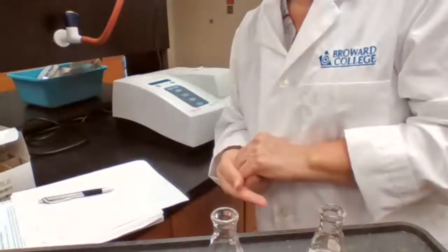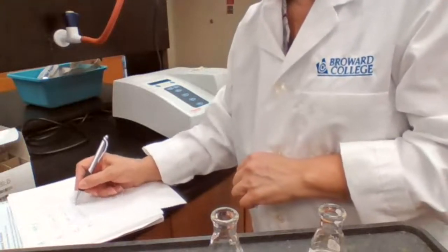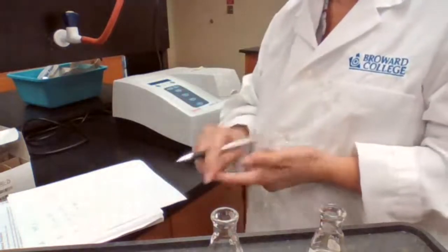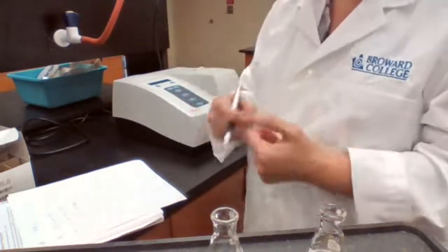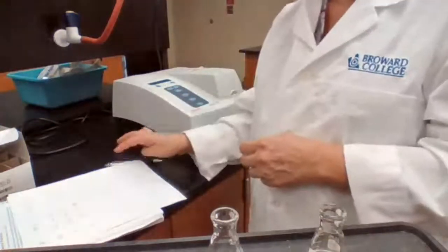I probably can start at 2:02 for sample D, 2:02 going to 2:07, because if I do back to back, if I start the other one at like 2:01, 1 minute time is not going to be enough for me to test B and then be ready for C. But if it's 2 minutes, I think I can do it. It doesn't take that long.